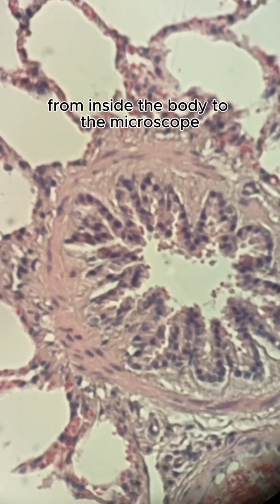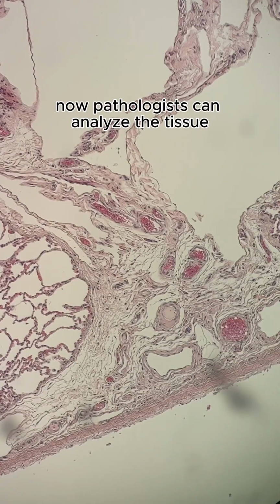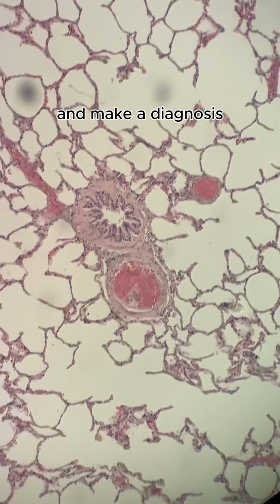That's how lung tissue goes from inside the body to the microscope. Now, pathologists can analyze the tissue and make a diagnosis.